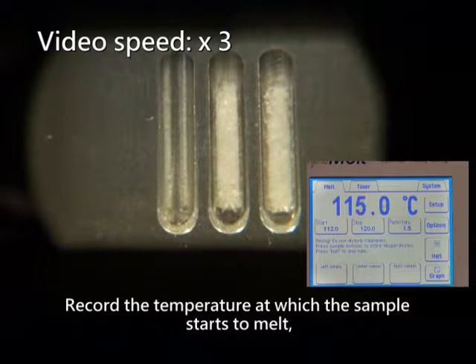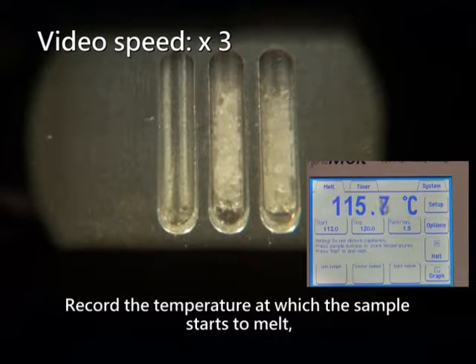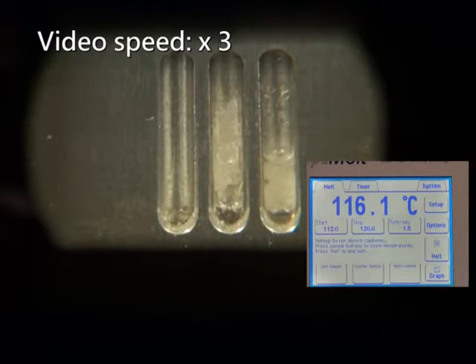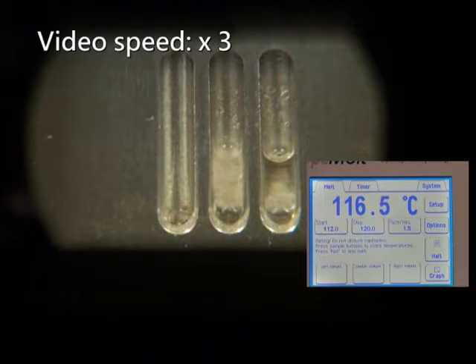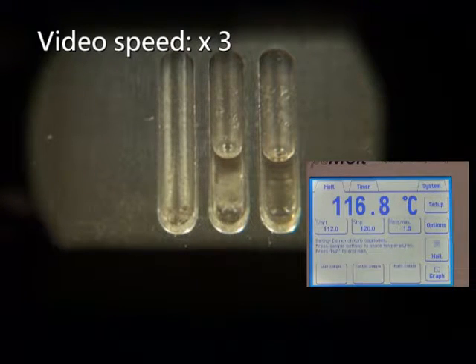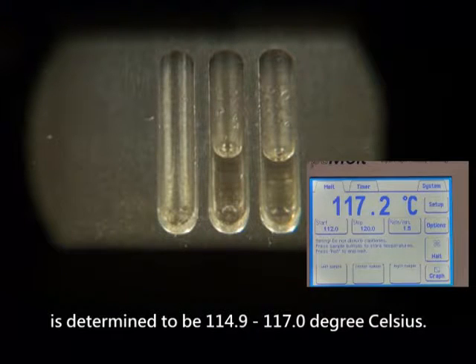Record the temperature at which the sample starts to melt, and the temperature when the sample melts into a liquid completely. The two temperatures give the melting point range of the sample. For example, in this demonstration, the melting point of the sample is determined to be 114.9 to 117.0 degrees Celsius.